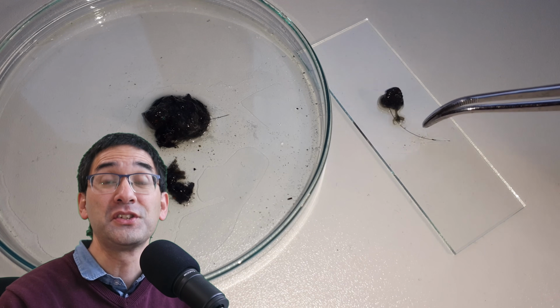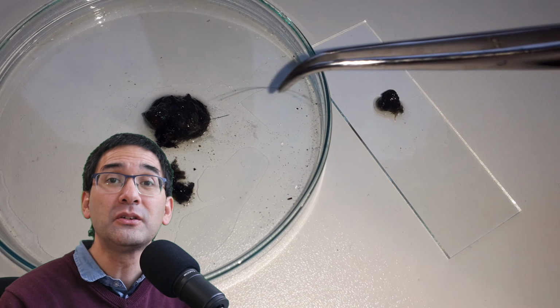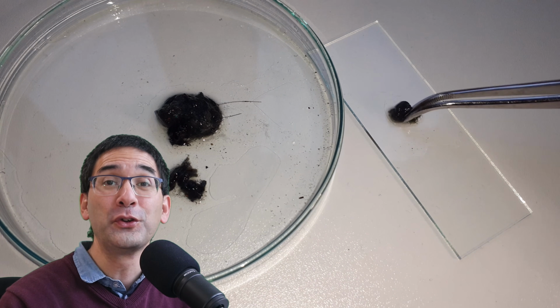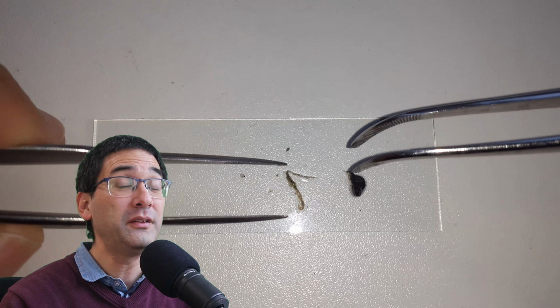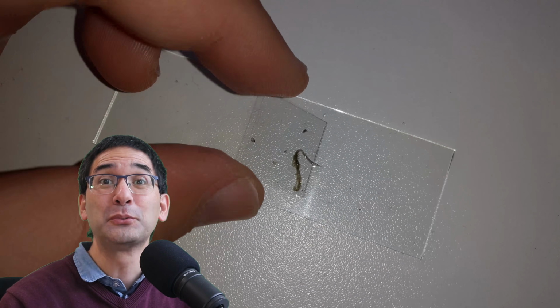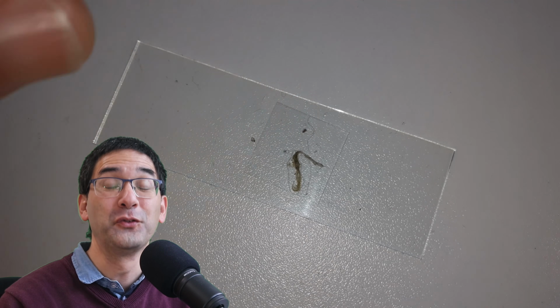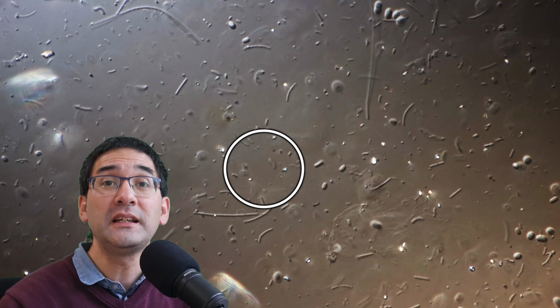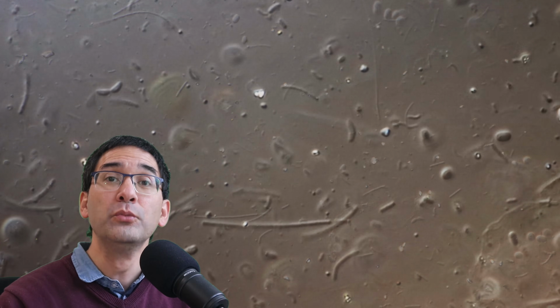I show you today. Because as a matter of fact, only a very small number of bacteria can even be grown and cultivated in the laboratory for further analysis. This means that some of the bacteria that I show you today, well, they were the first times they were ever shown since the existence of mankind, and probably also the last time, because maybe we're not able to cultivate them in the laboratory for further study. As a matter of fact, far less than 1% of the bacteria most likely can even be cultivated in the lab. Well, but in any case, they are quite interesting to observe, especially those that move around.